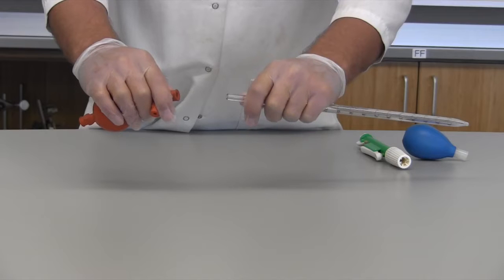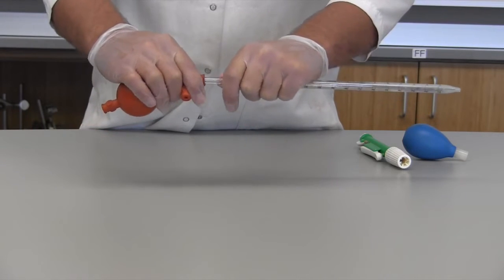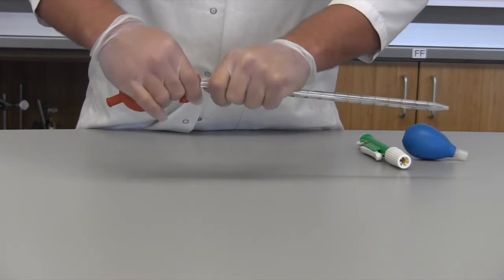This is how you properly put on a pipette bulb. You want to grab the bulb and pipette close to where you are joining them and twist.